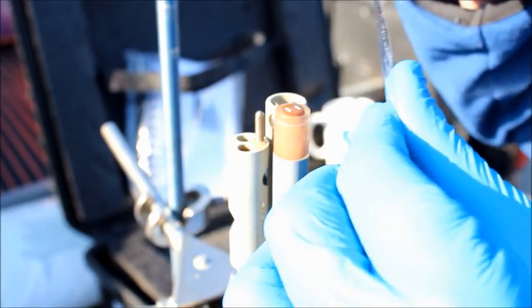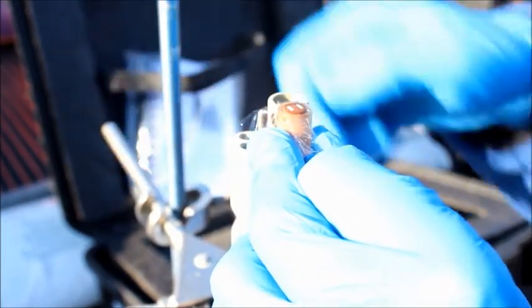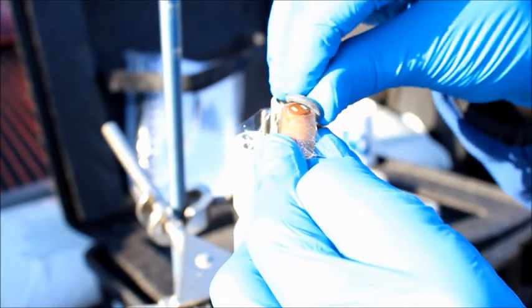Next, he stretches a new membrane over the end of the probe and seals it in place by pushing the O-ring over it.